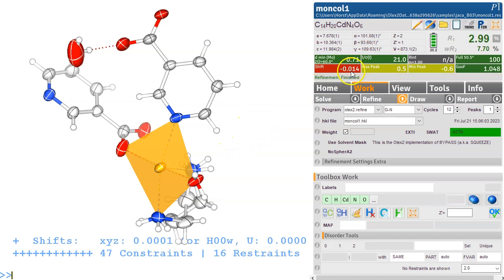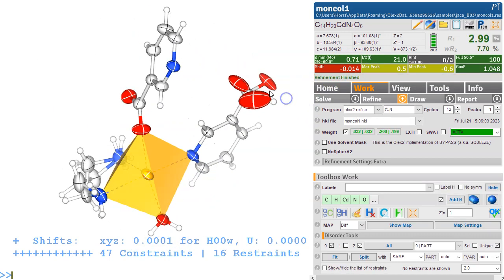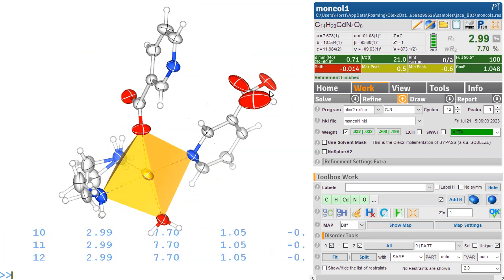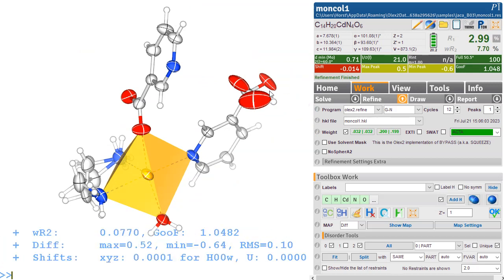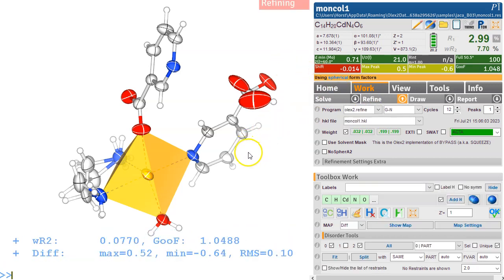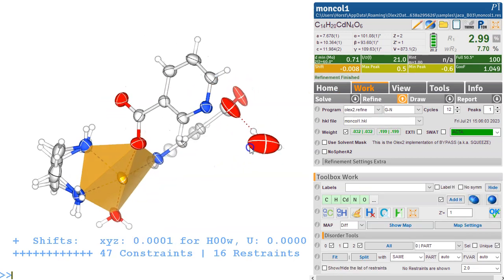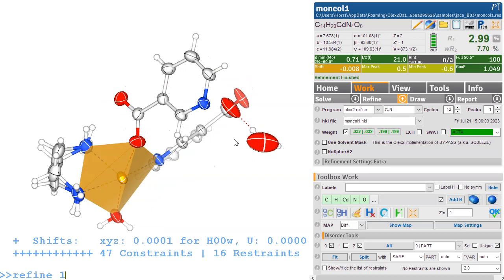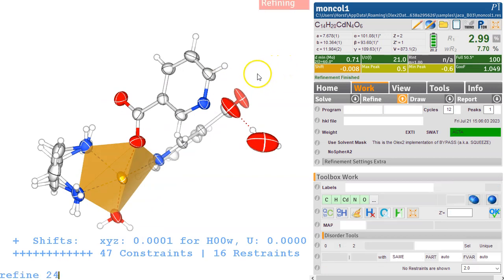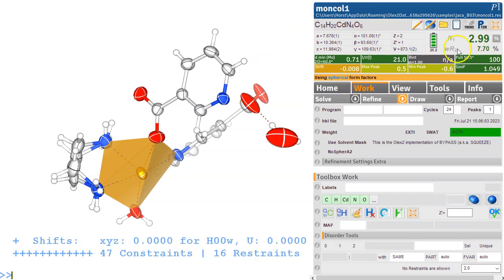We can click on this and then we should see what's moving. We can't see what's moving, so the listing page up will tell us. No, it doesn't actually tell us in this view. It's interesting. Right, so refine this a few more times and then this will settle. Now, okay, I'm giving it 24. It just needs a few more cycles to settle completely. And hopefully now it will be settled.